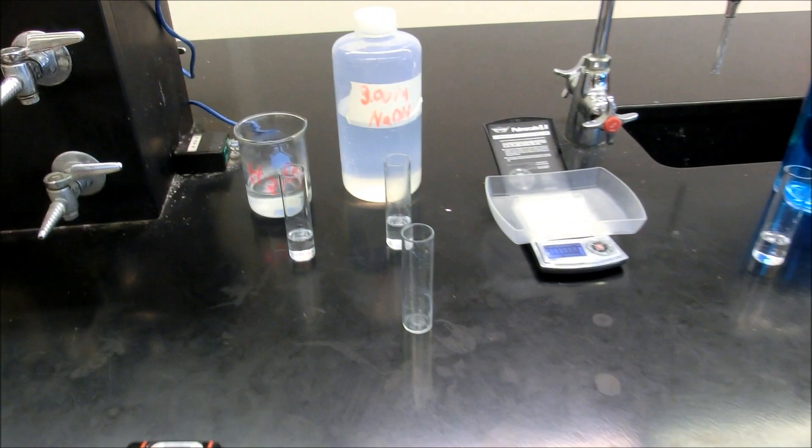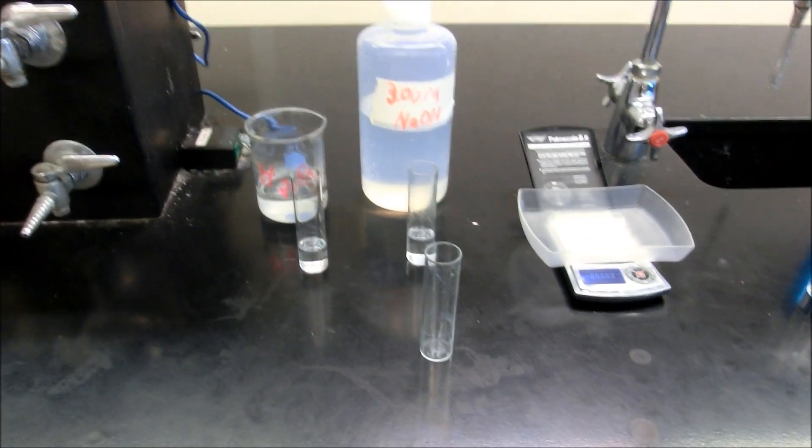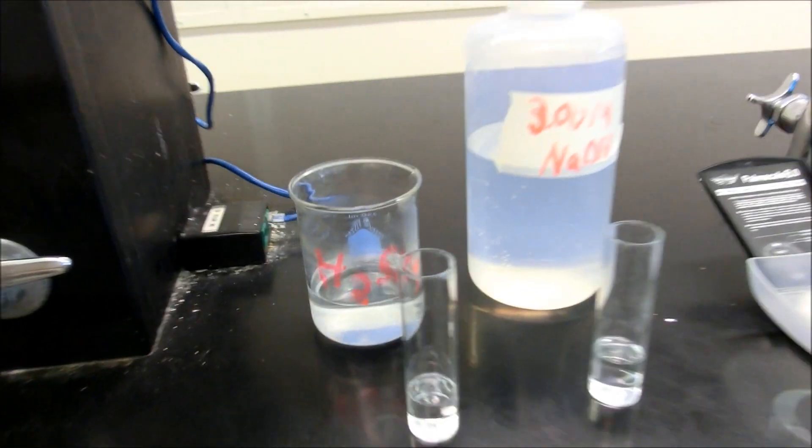Hey folks, this is going to be a quick video about all four reactions that were used in the evidence of chemical reactions lab for my class. Let's take a look at what we have here.